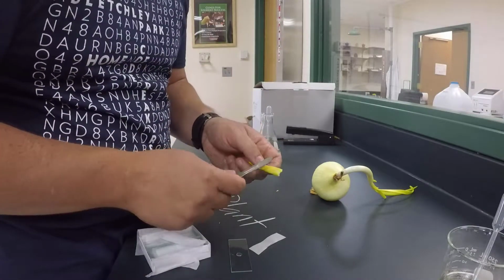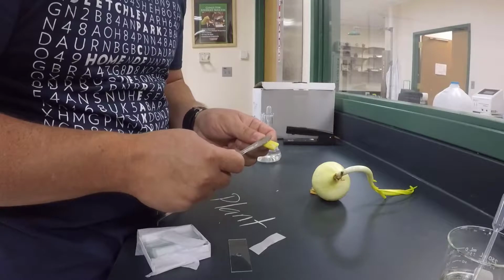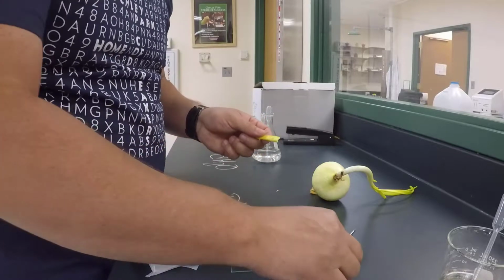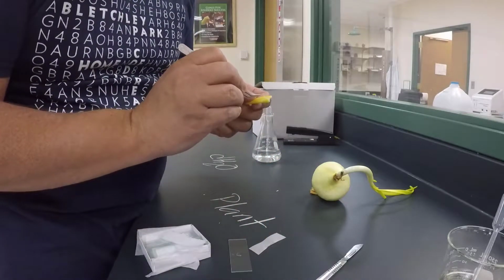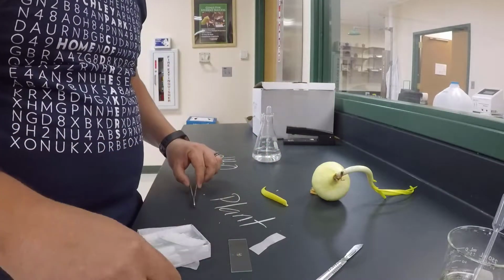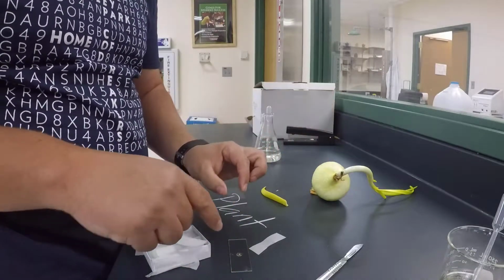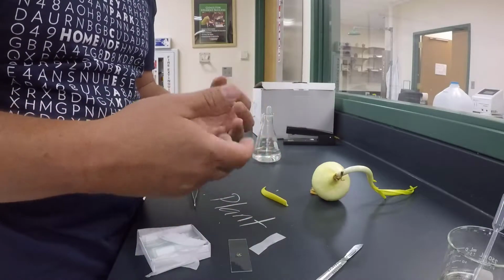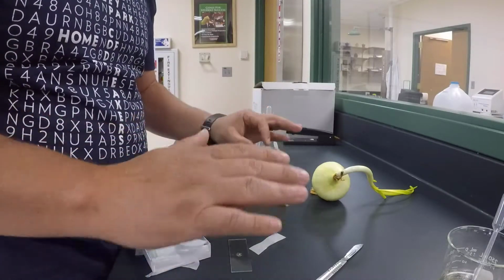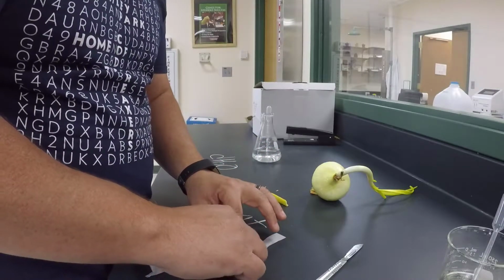And then in this case I'm just going to take a scalpel, and I want to cut just a really thin, as thin as I can get, chunk of material. I'm going to take a pair of forceps, remove that material, place it in the water, and then I'm going to take a glass cover slip. This is to protect the scope so nothing gets on the objective lens, but it's also to hold the material down. A lot of times it'll allow the material to lay flat. And then I'm going to place that cover slip on that material.